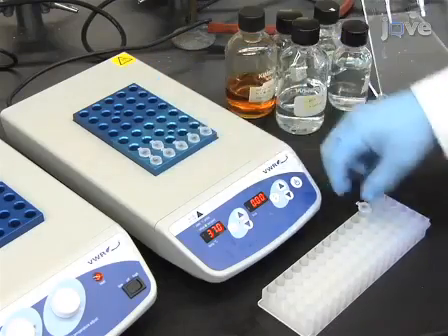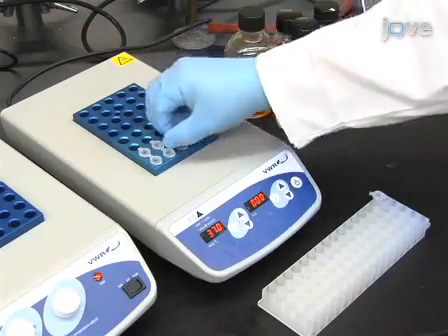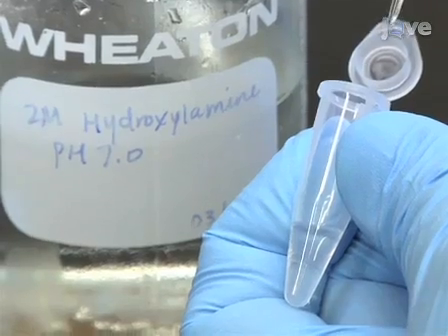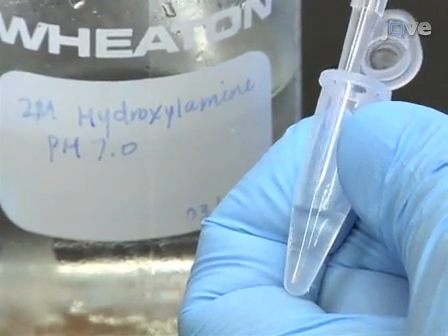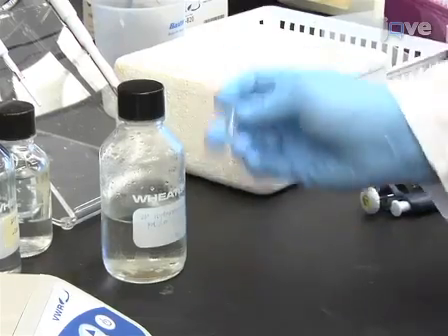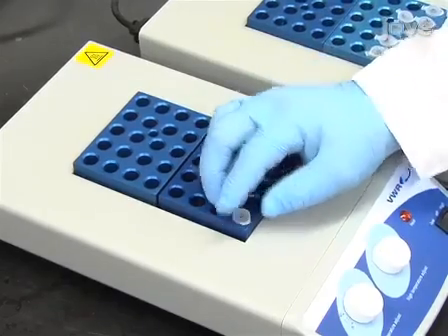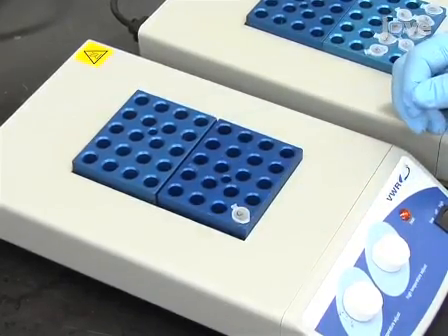Equilibrate all samples in a 37 degree Celsius heat block for 1 minute. Now add 50 microliters of 2 molar hydroxylamine hydrochloride. Mix by shaking 3 times and incubate in a 60 degree Celsius heat block for 5 minutes.